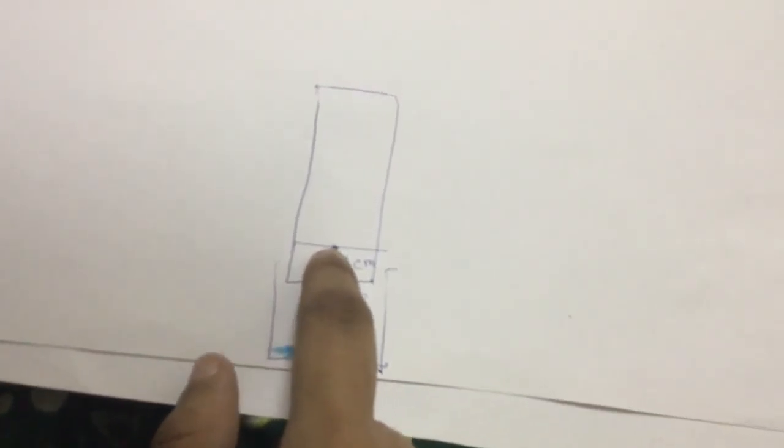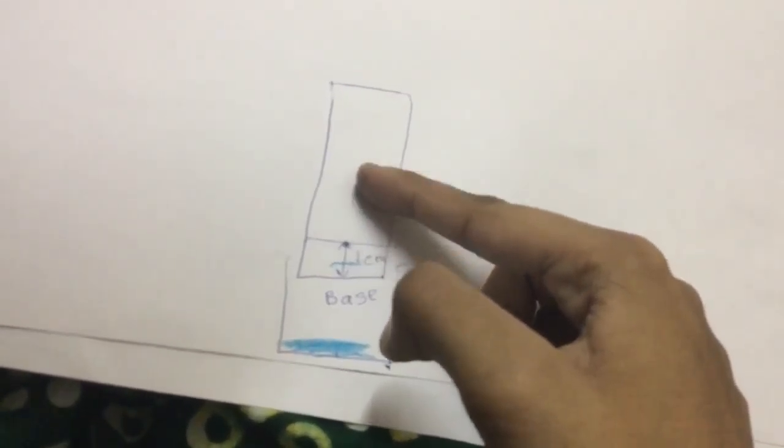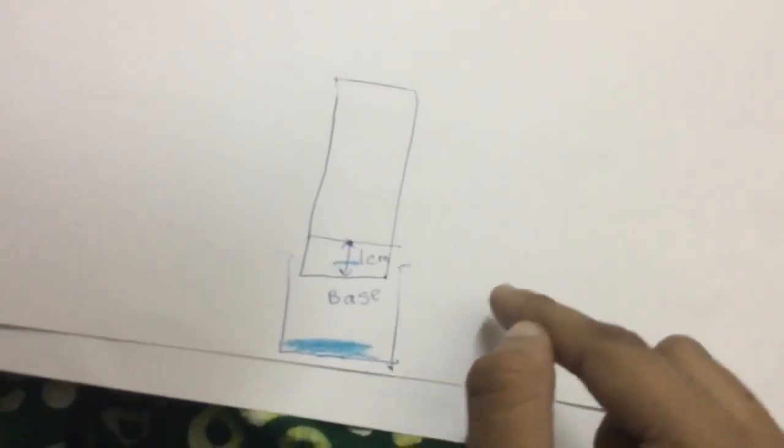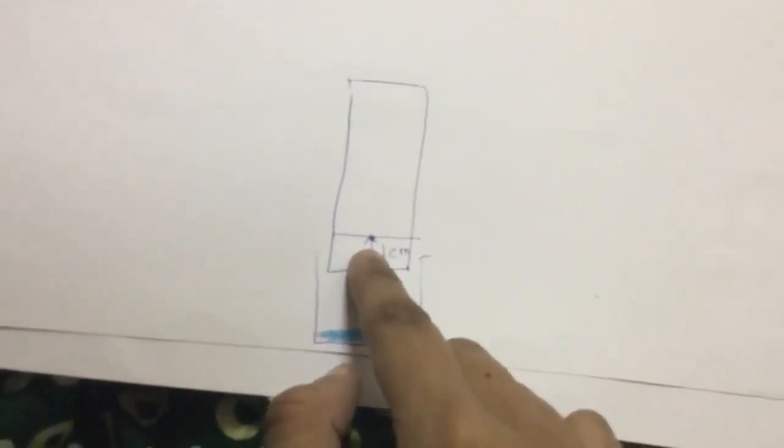So as the water rises, you'll notice the different colors that will come out of this dot like this. Those are the different substances that have been used to create this type of ink or sketch pen ink.